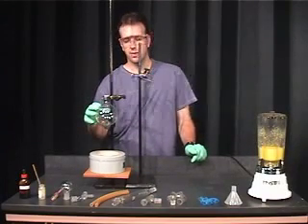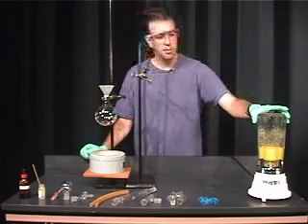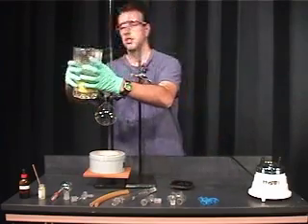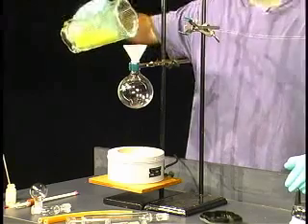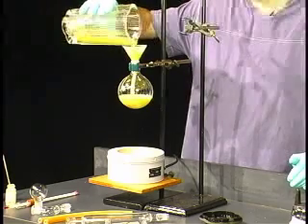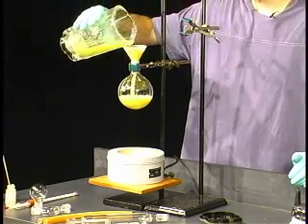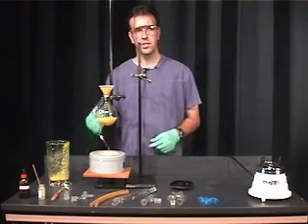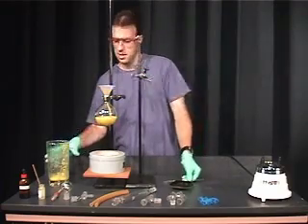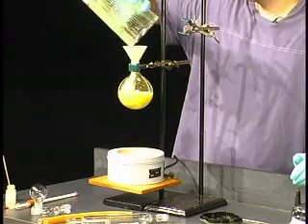I've already secured the 500 milliliter round bottom flask and we can add our powder funnel and transfer the blended solution of oranges. If we've done a fairly good job of blending, it should have no problems going through. We've had a slight obstruction here — I have a spatula to break that up a little bit and we can add the rest of our solution. It's always better to blend too long than not long enough.